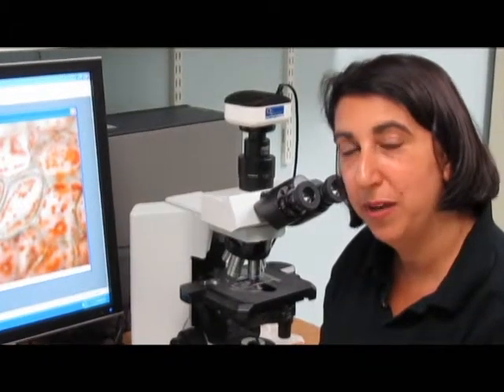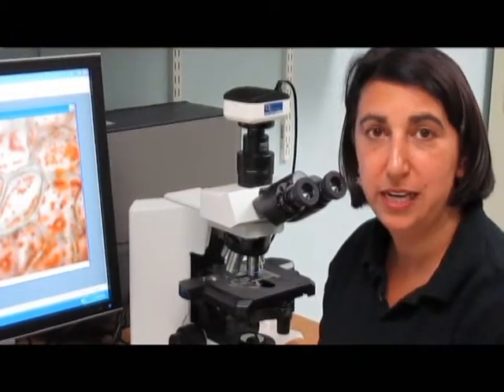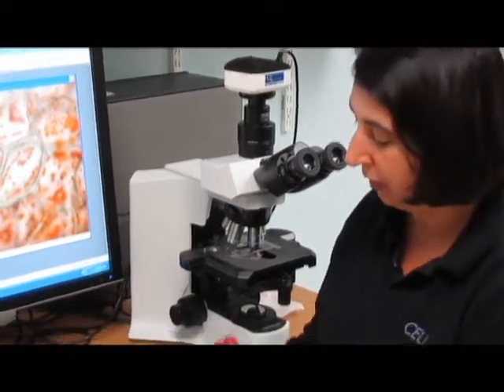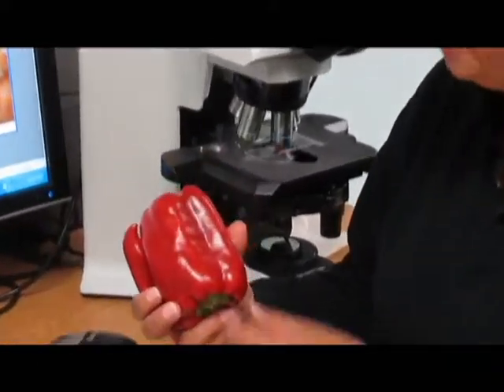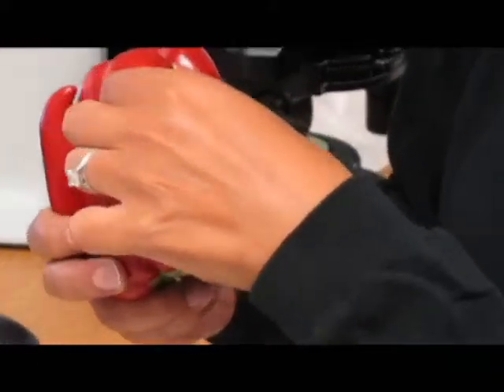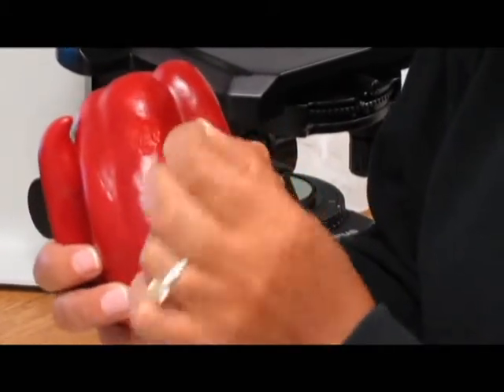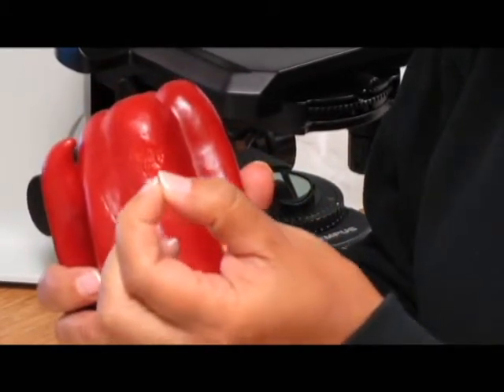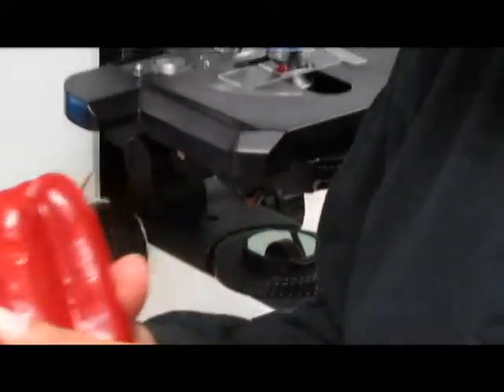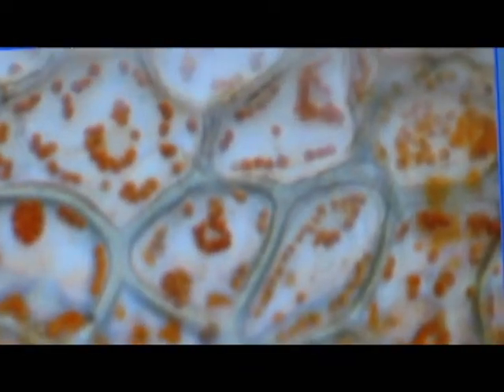I'm going to show you how one could model a red pepper cell using the dynamic cell model kit. All you need is a red pepper. You can just peel away a little bit of the skin from the red pepper and put the skin on a slide with some water to make a wet mount. Once you've done that, you have something like what I have on the microscope here.